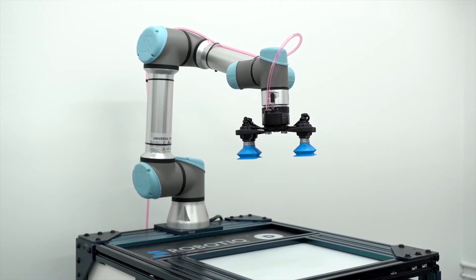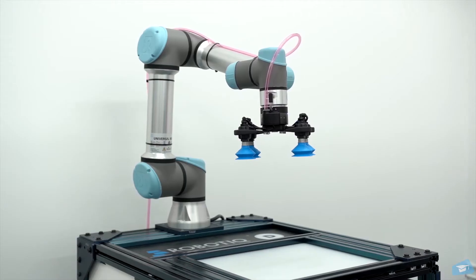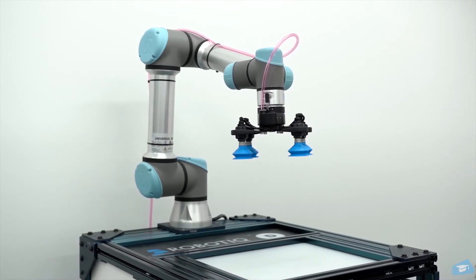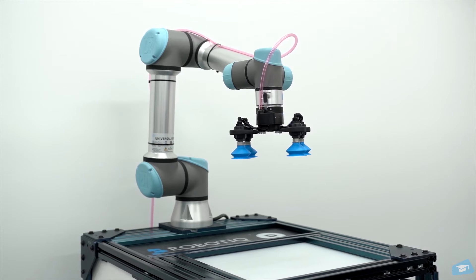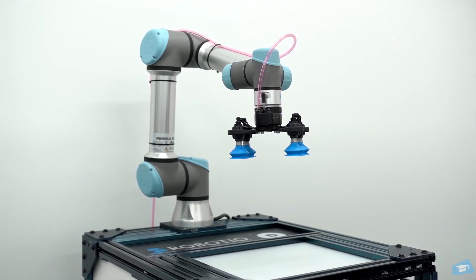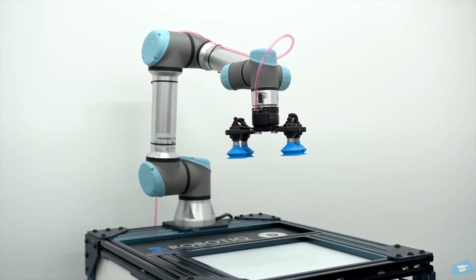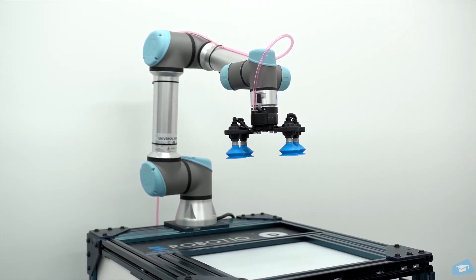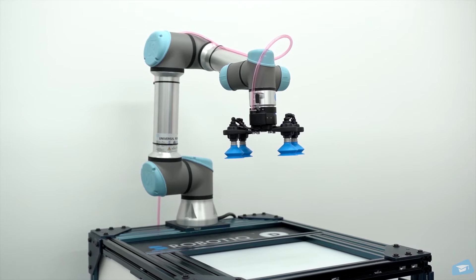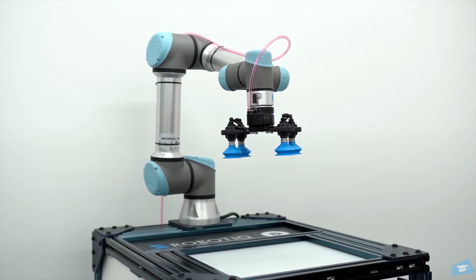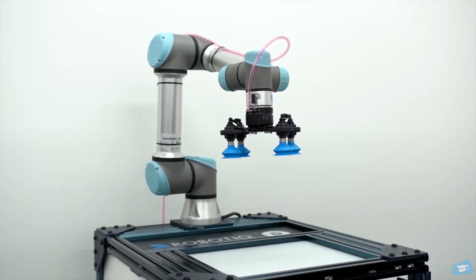Welcome to this introduction video on how to install your Robotiq Airpick Vacuum Gripper mounted on an E-Series Universal Robot. For more information on the programming of the Airpick Vacuum Gripper, please refer to the corresponding videos.